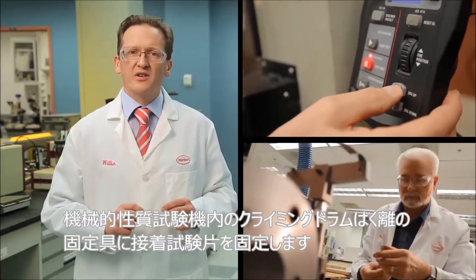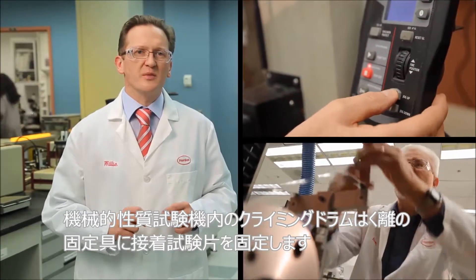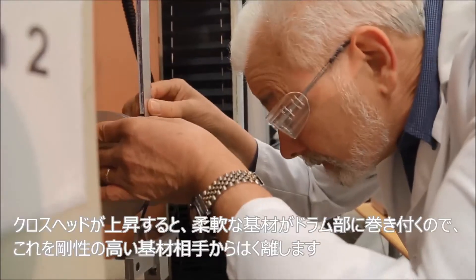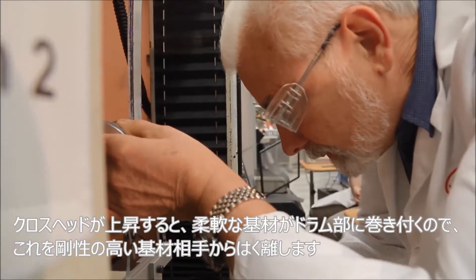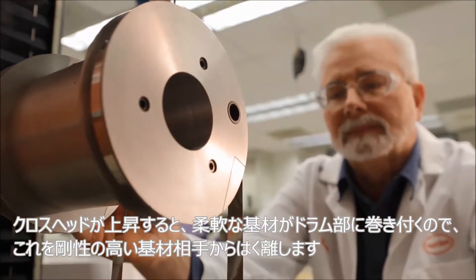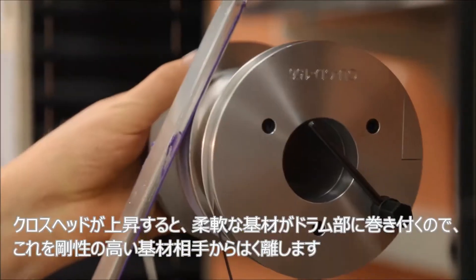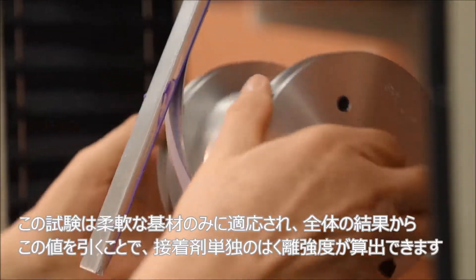A bonded assembly is secured in the climbing drum peel fixture in a mechanical properties tester. As the crosshead moves upward, the flexible substrate is wrapped around the drum fixture, peeling it away from its rigid mate.